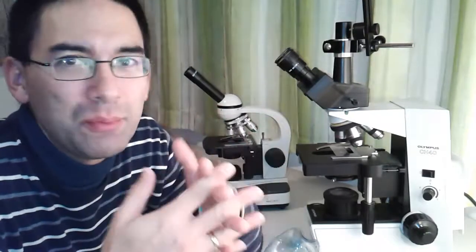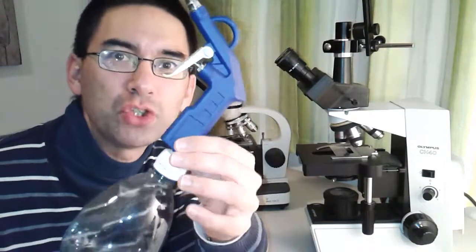So I was not able to find any compressed air canisters. So I decided to make one myself, and in this video I'm going to show you how I did that, and I'm just going to show you very quickly. It's really a very simple construction.